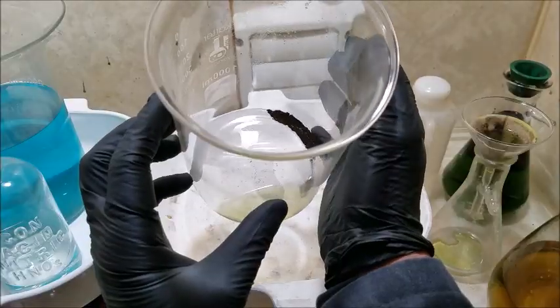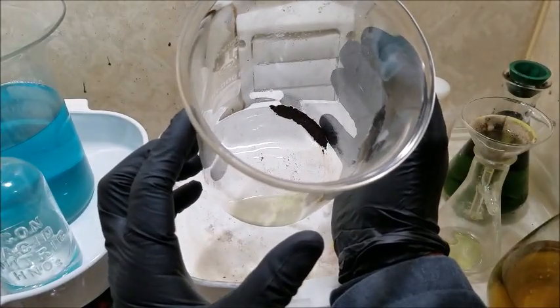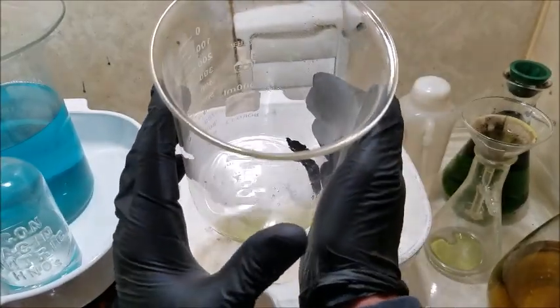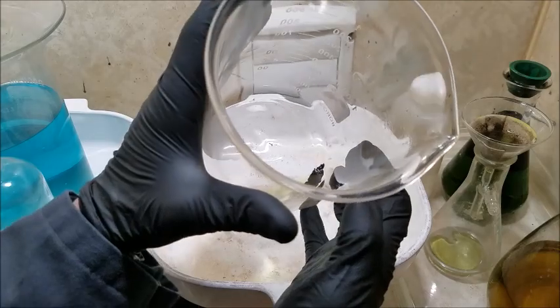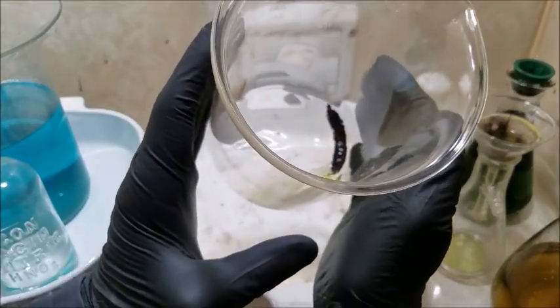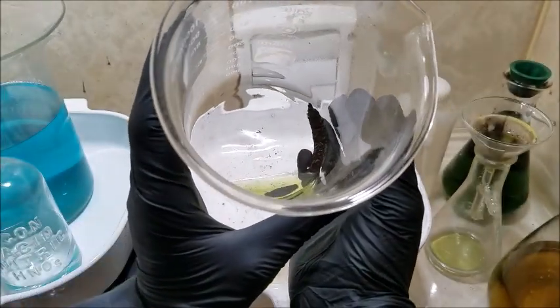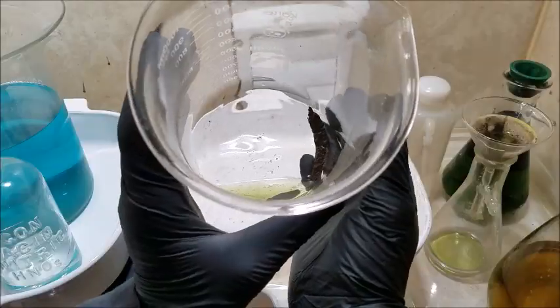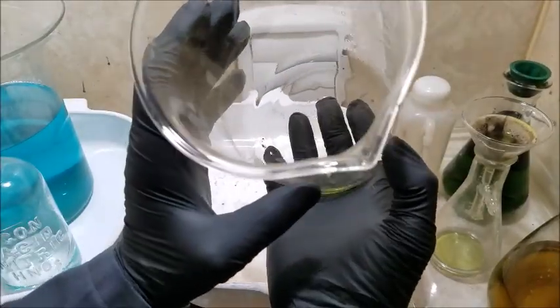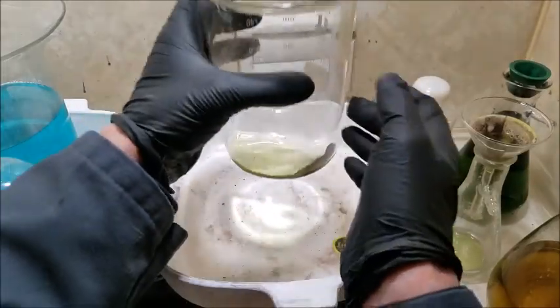Gold can precipitate out of solution in almost a light brown, coppery color. It can also precipitate out in a finer, darker, almost black color, which we're pretty much seeing here. So this is possibly gold, but I don't know how pure it is. I mean, there's gold in here. We did get some positive result.